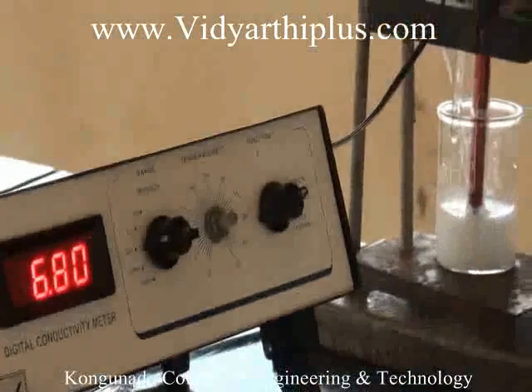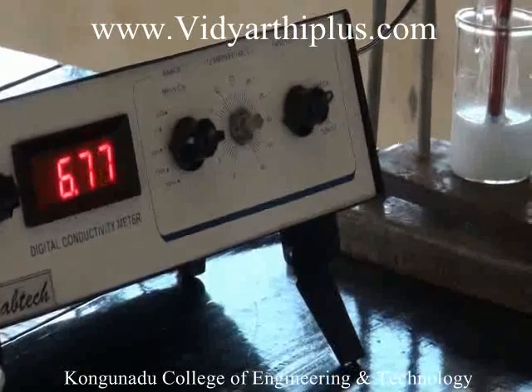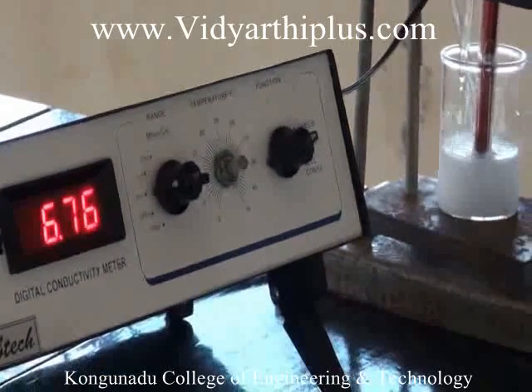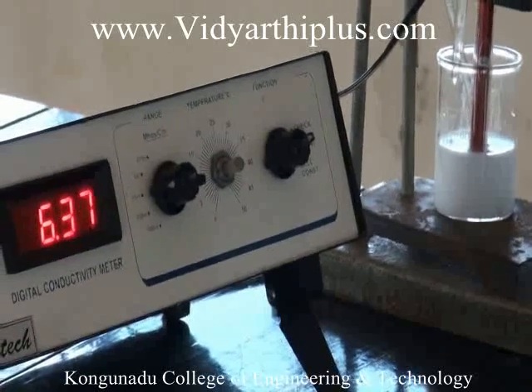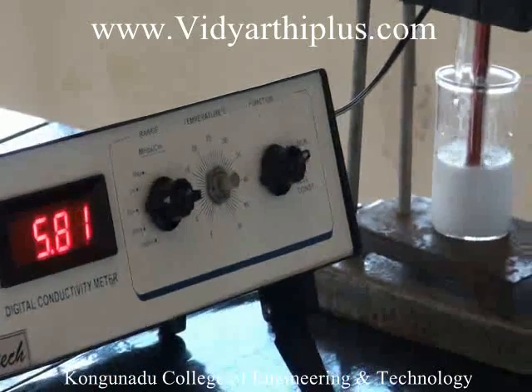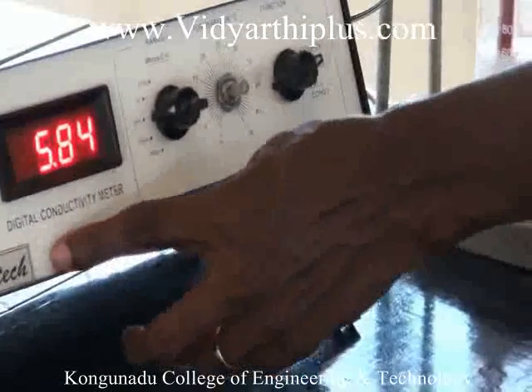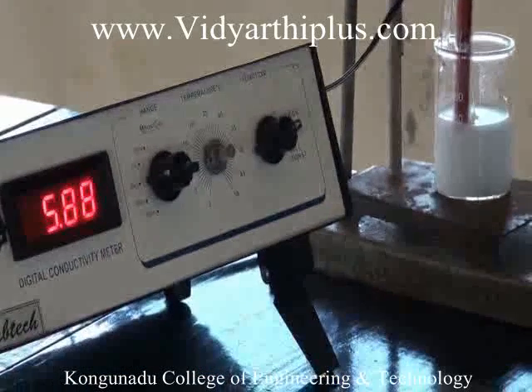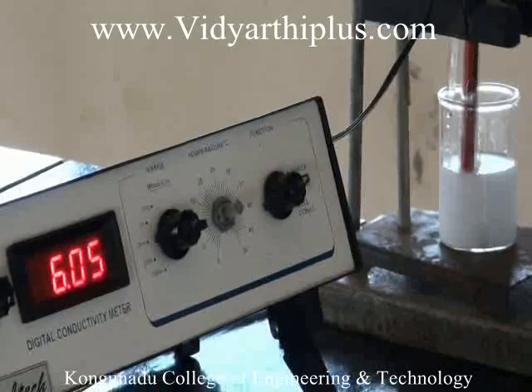The values are noted from the burette until the increase in conductance. The conductance values increase at a certain stage when all the barium chloride solution reacts with sodium sulfate to form barium sulfate. The values are noted till the end point is reached, which are increasing on the digital conductivity meter. The titration is also done even after the end point is reached to get a proper graph.